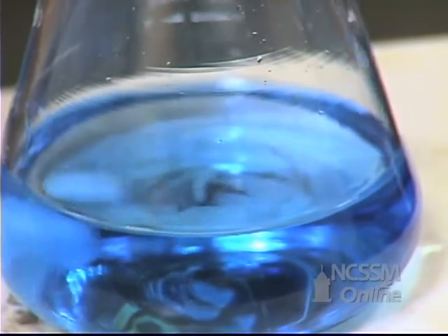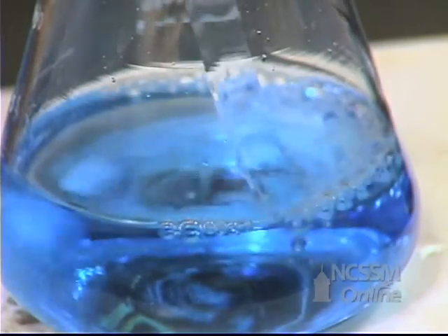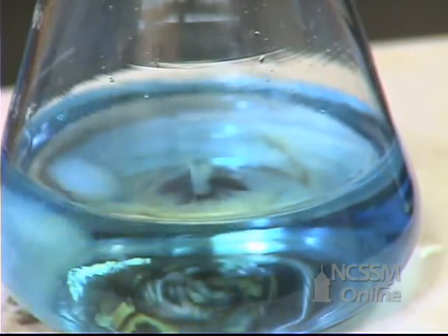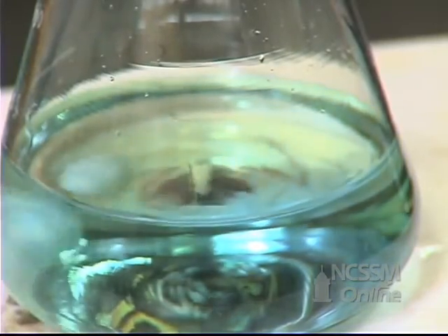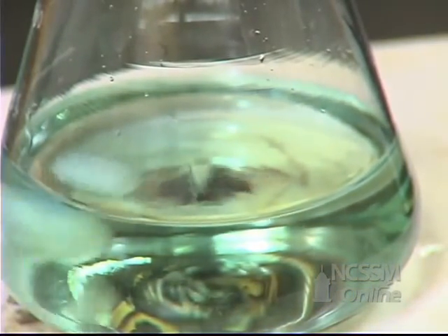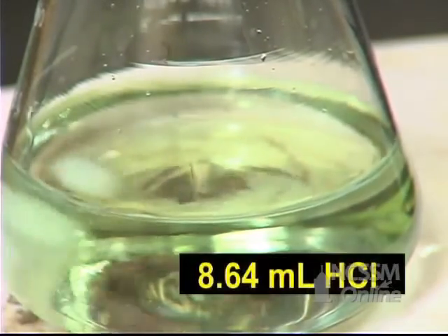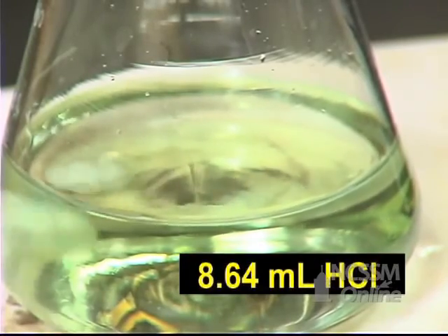We're close to the endpoint. We're going to rinse down the walls of the flask. We've now reached the yellow endpoint and we'll take a final burette reading.